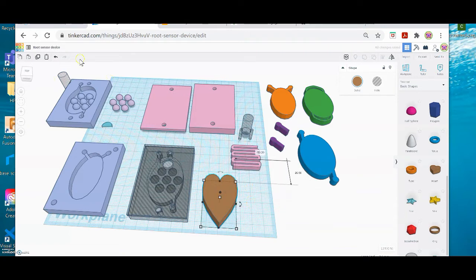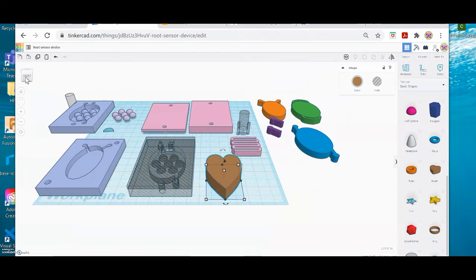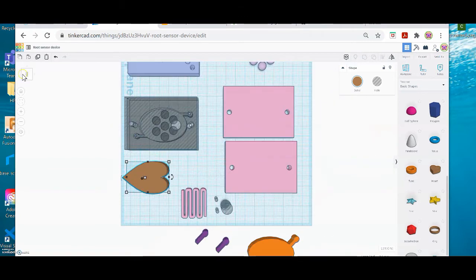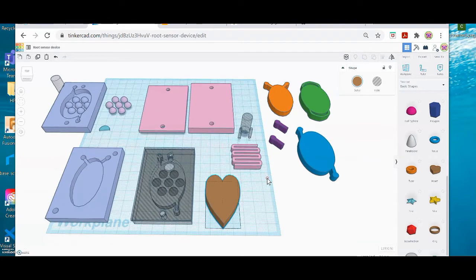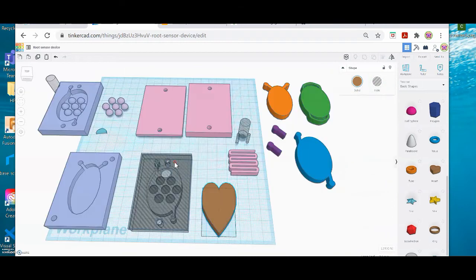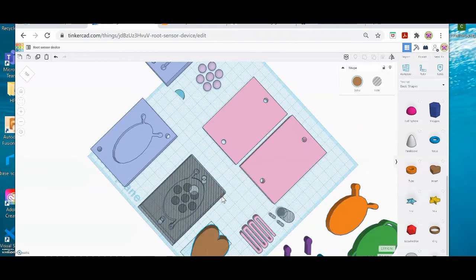It's very important to move in different perspectives in Tinkercad. So to start with, let's observe this cube at the top left. This here enables you to move to different edges of your view. And this is moving in the Cartesian coordinate 3D planes. You can also right-click, this is what I do, right-click on my mouse and slide around, and that enables you to orbit as well. If you want to pan, that is move sideways in the same plane, or up and down, you can hold the rollerball on your cursor and move right to left. That's called panning. Orbiting is when you're shifting into different perspective planes.